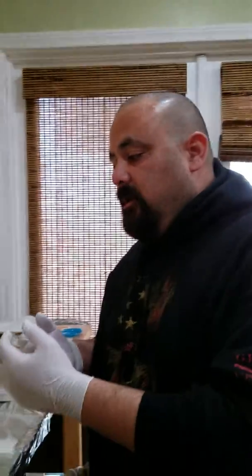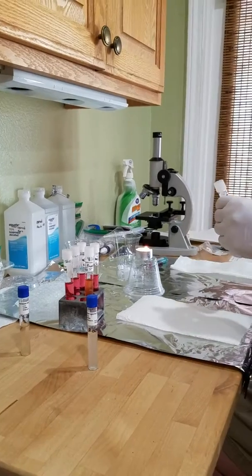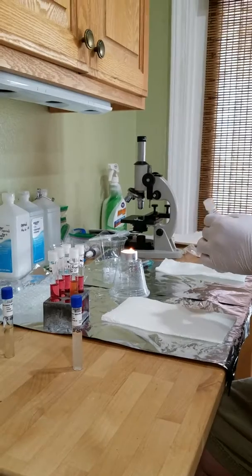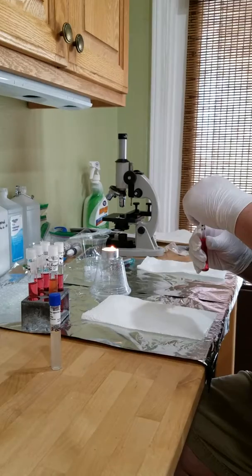So the first thing we're going to do is, I already flamed opening and closing when I introduced the carbohydrate into it. And then I will do the same not only for my samples, but my phenol red tubes as well. So let's go ahead and do one at a time. We have two of each, and we have 6 tubes. I'm going to do all of the cerevisiae first, and then we're going to do the others because I only have the 2 pipettes. So I'm going to open and flame these in order.